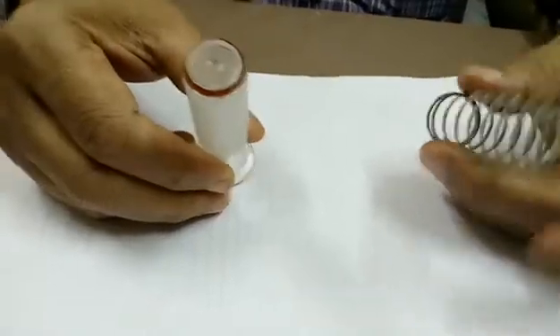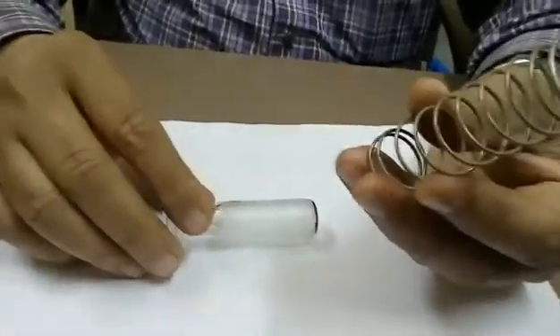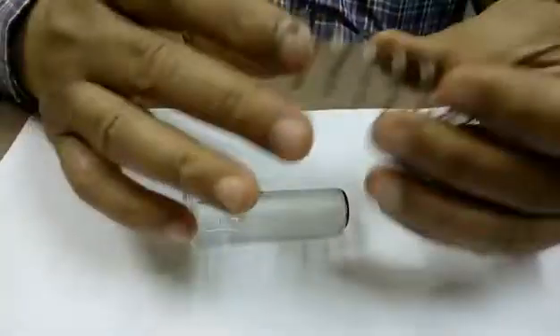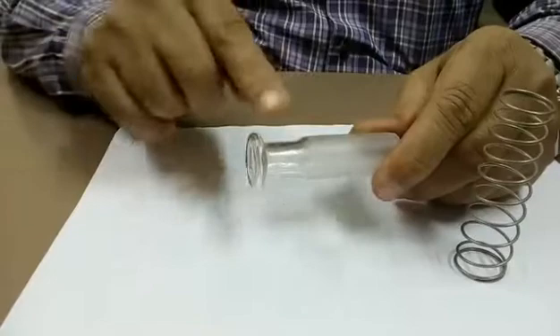And this is Corto spring. Here this spring is conical, one end is smaller in diameter and the other is bigger in diameter. You can see here the plunger goes smoothly, here the plunger doesn't go smoothly. This is kept smaller because of the difference in this diameter.